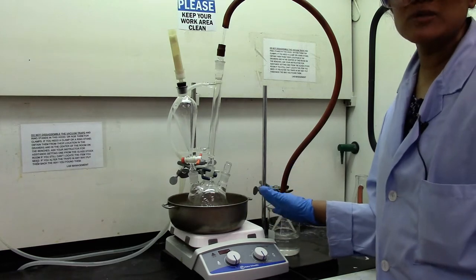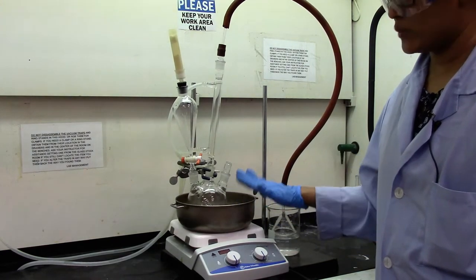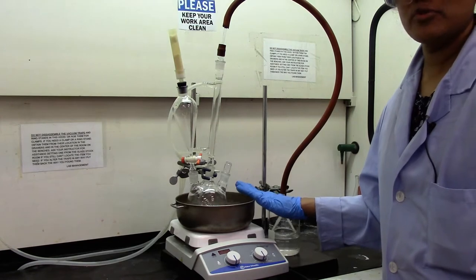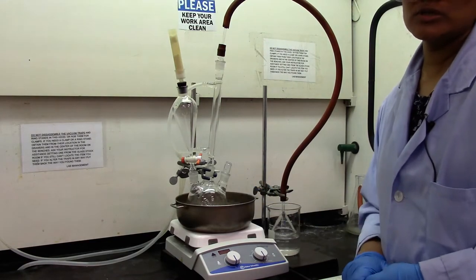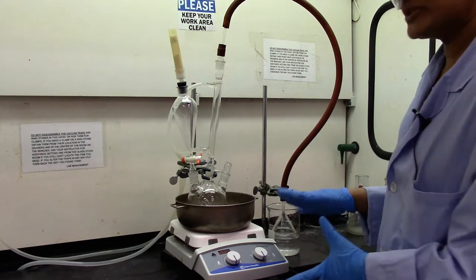So here's my overall setup. There's no chemicals in here yet. This is a bath for ice. I will put some ice in here in a few minutes. So let's get all the chemicals ready, weighed, to start the reaction.